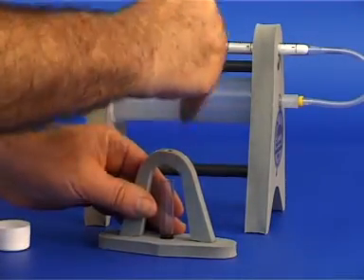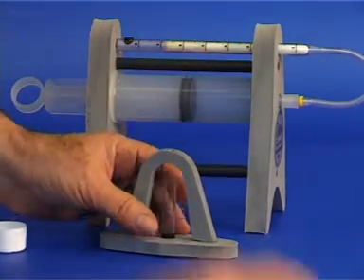Next, remove the test tube and observe what was extracted from the cotton filter.